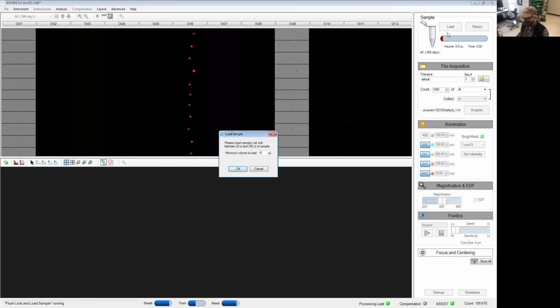Software is asking me how much volume do I need. Typically, you don't need all that much if you keep your concentration of cells fairly high. You should be able to run with 30 microliters and get enough events for your experiment. Click OK. Sample goes up, and in a few seconds, we're going to start to see data showing up.